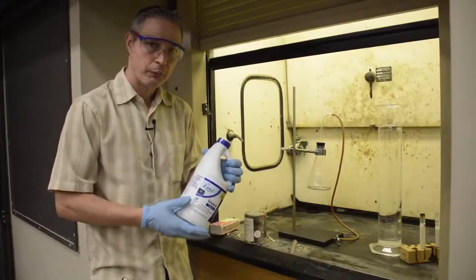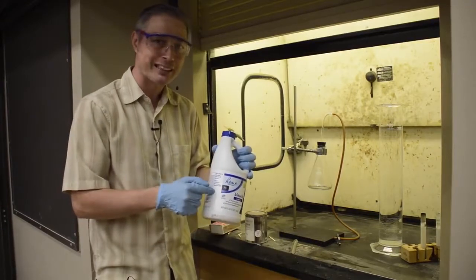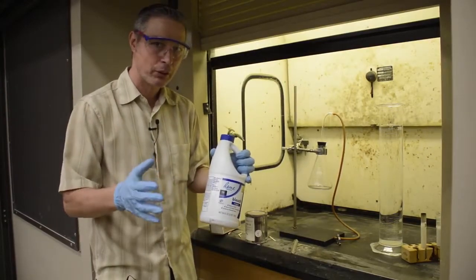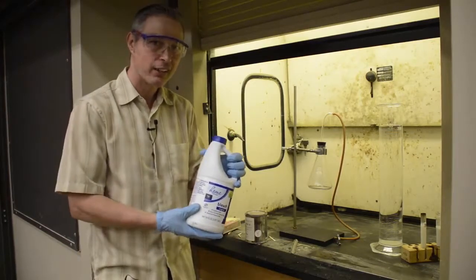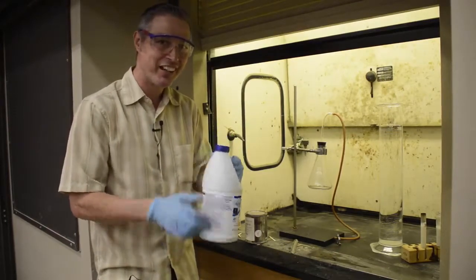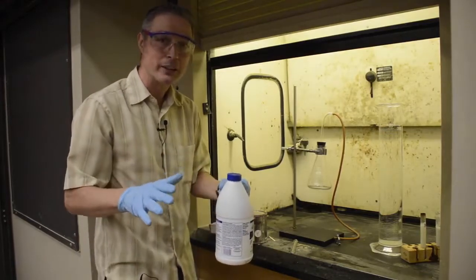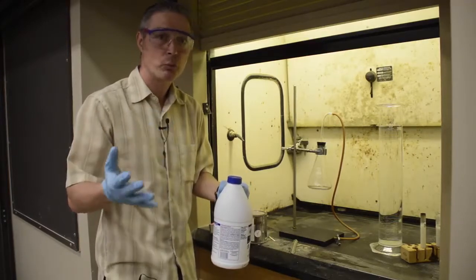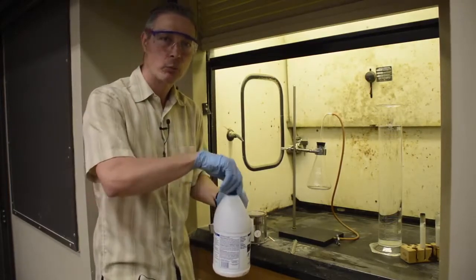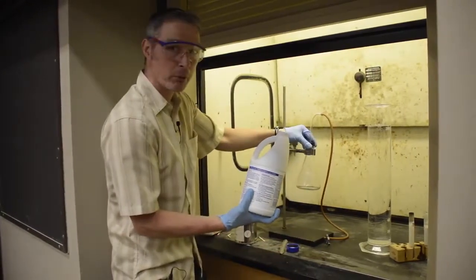Okay, now first of all, the reason you're watching a video and not doing this at home is because this is bleach, which is the household chemical that is actually responsible for most accidental poisonings in the United States and everywhere. So don't be putting the wrong thing into bleach. You're going to make chlorine gas. If you breathe chlorine gas, it was what was in mustard gas in World War I. But I'm going to do it in here in the fume hood, so things should be relatively safe.